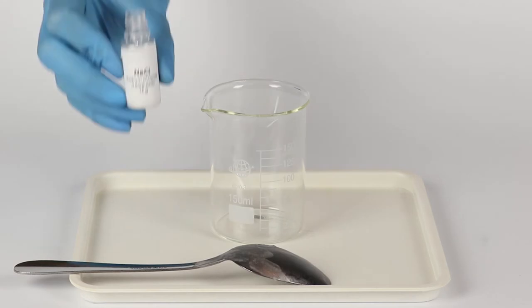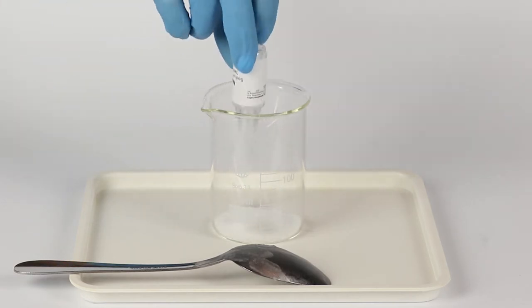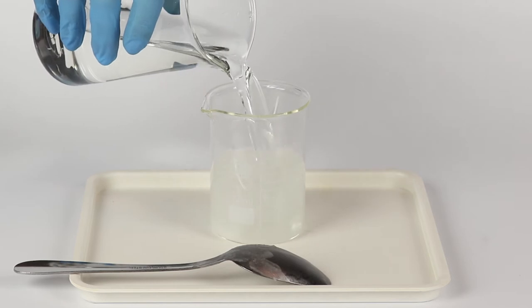Now pour one bottle of sodium chloride into your beaker. Fill the beaker with hot water and stir the contents.